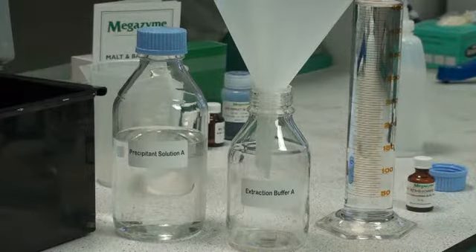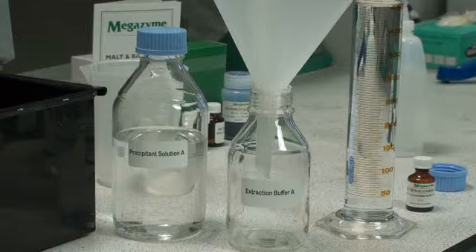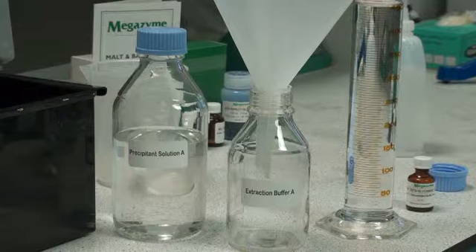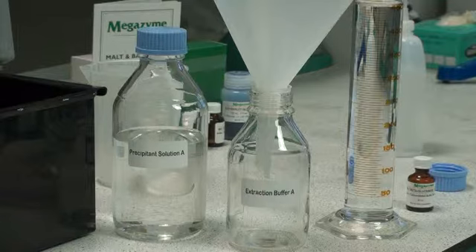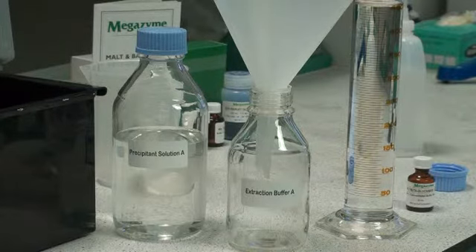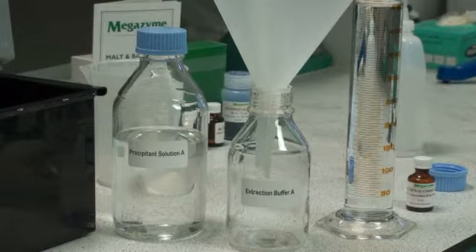Precipitant solution A is prepared by dissolving 40 grams of sodium acetate and 4 grams of zinc acetate in 150 ml of distilled water. This is adjusted to pH 5 with concentrated hydrochloric acid and the volume is adjusted to 200 ml. To this solution, add 800 ml of methyl cellosolve or methoxyethanol and mix well. Store this in a sealed Duran bottle.